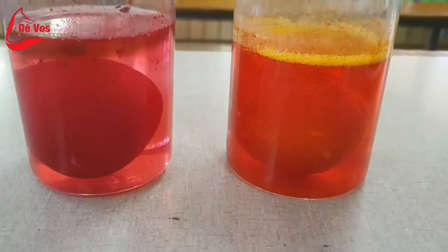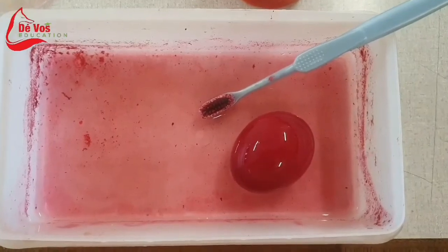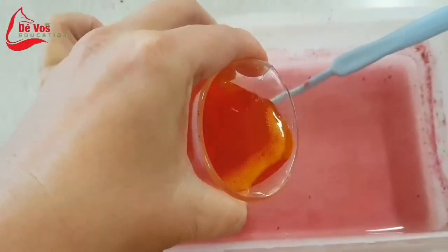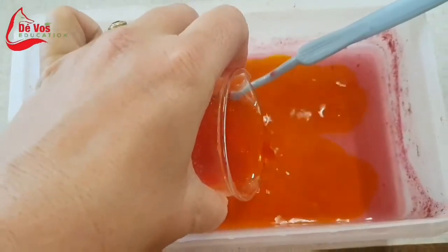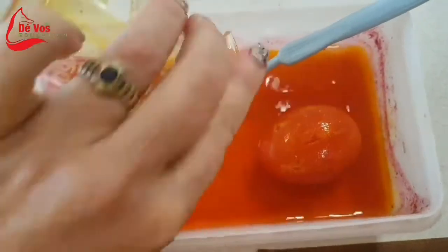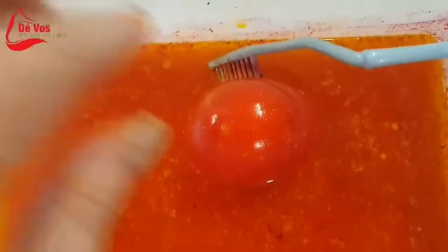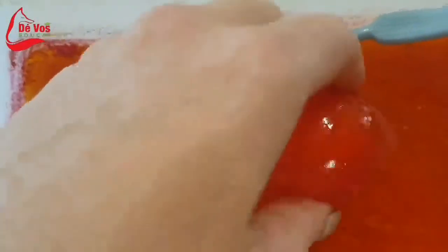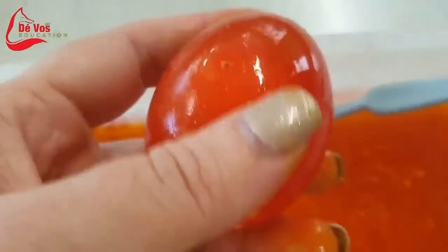Place the eggs very carefully into their containers and pour the vinegar over them. This must be left for a minimum of 24 hours. After 24 hours, the eggs can be removed and the last bit of the shells can be gently removed either by hand or, in this case, I used a toothbrush to very carefully scrub the calcium off.